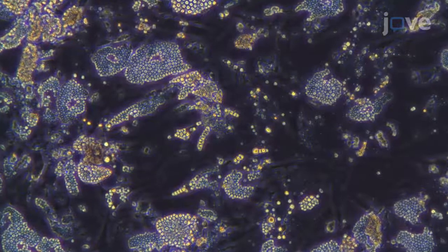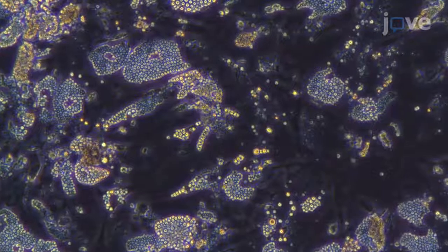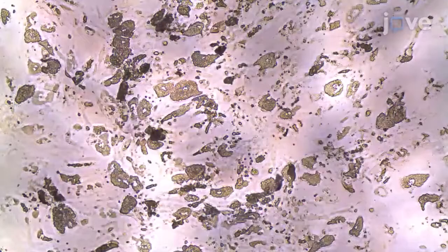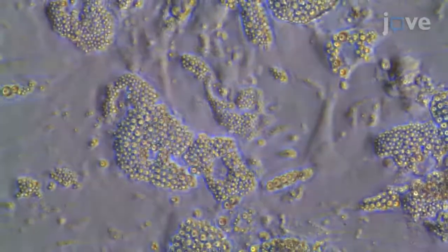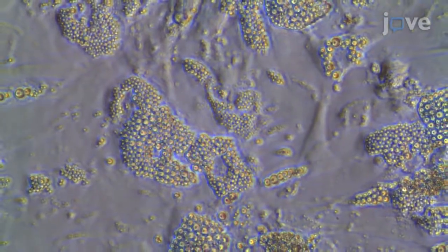Compared with standard 2D cell culture, our 3D model allows for more robust examination and dissection of crosstalk between adipocytes and adipose tissue ECM in the context of type 2 diabetes.